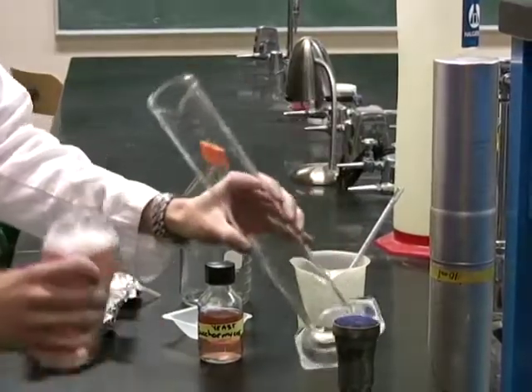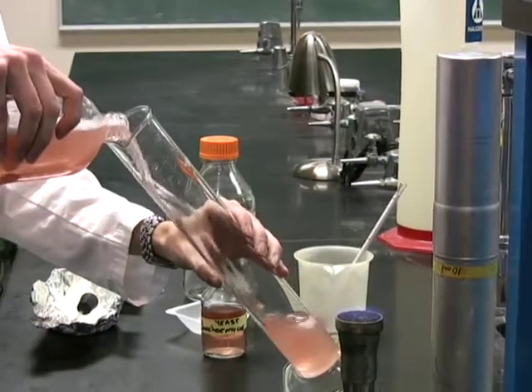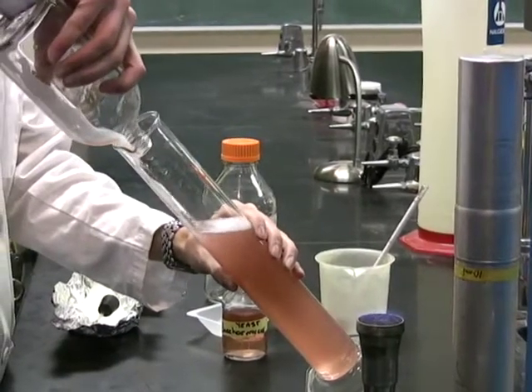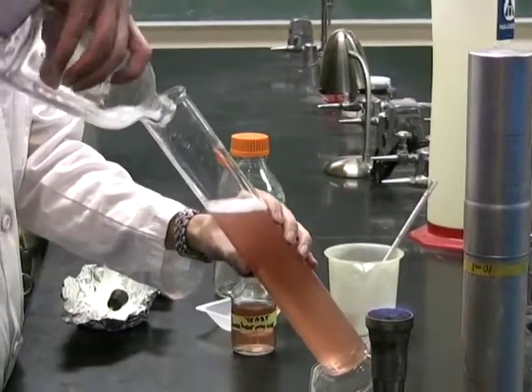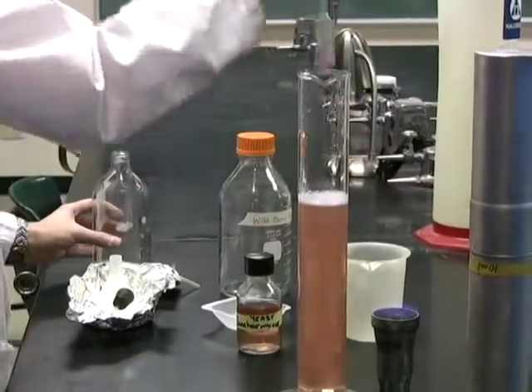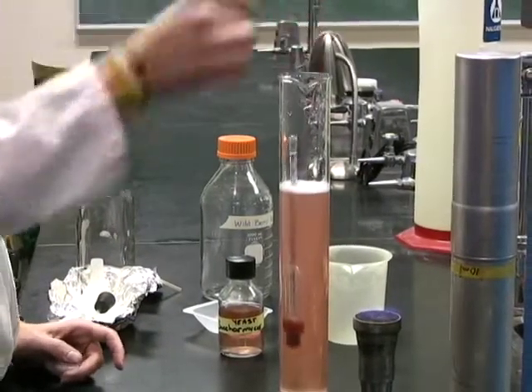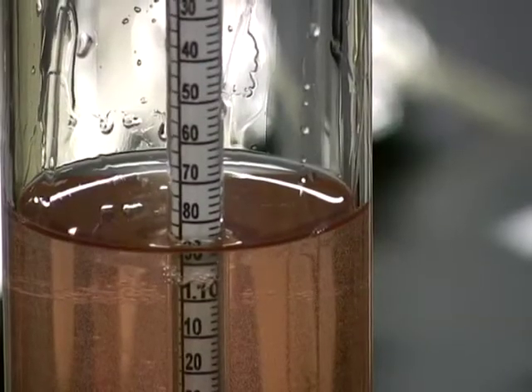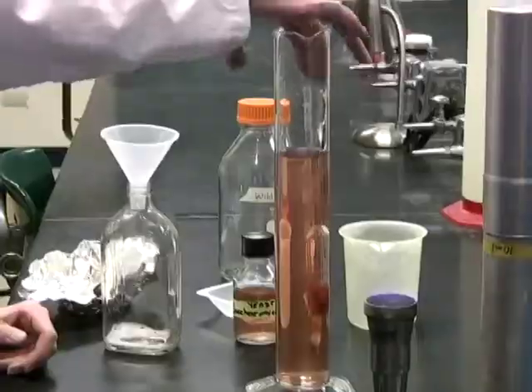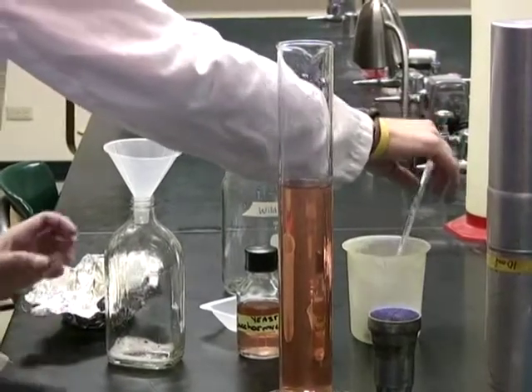Next, remove the stopper and pour the mixture into a 500 milliliter graduated cylinder. You will want to pour slowly so as not to get a lot of bubbles in the cylinder. We are now going to read the specific gravity. Place a hydrometer into the cylinder. You can gently spin the hydrometer to remove any bubbles that do form. The reading on this sample is about 1.085. Take the hydrometer out and pour the juice back into the bottle.